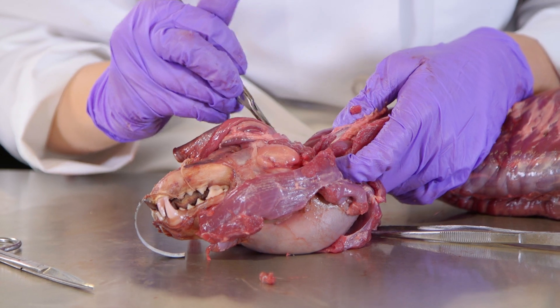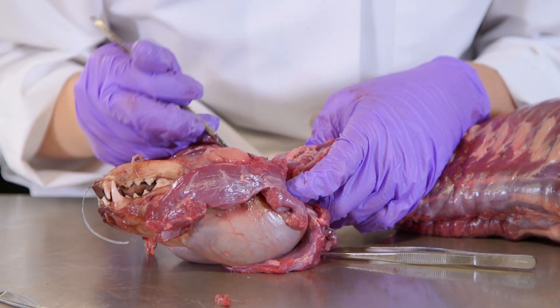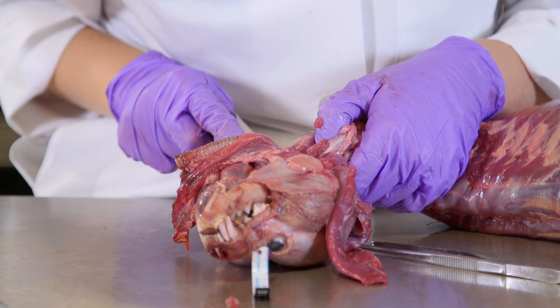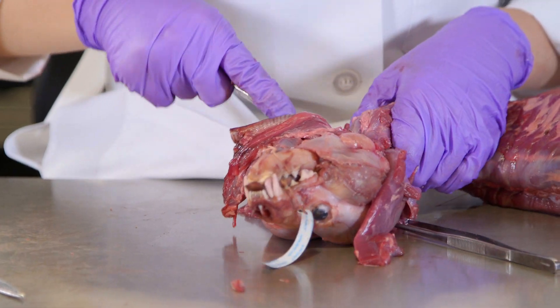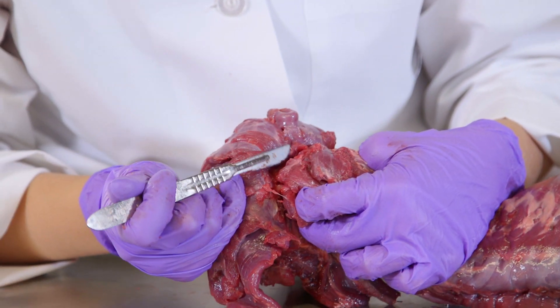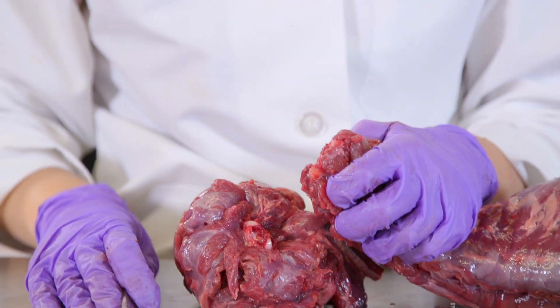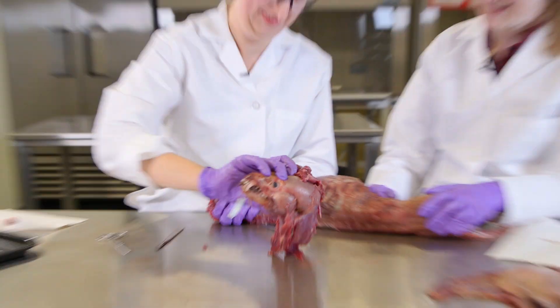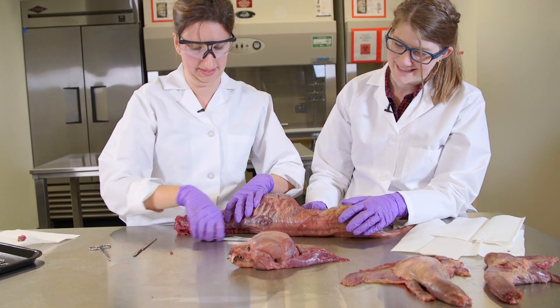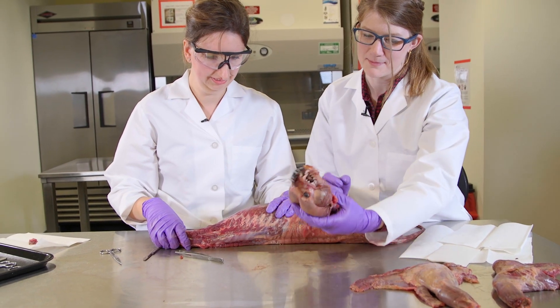It's probably for the best that it's difficult for your head to be removed — we're almost through, just one little bit. And it lost its head. So the head and all of the neck muscles. It's somehow more disturbing with just the neck muscles as part of it.